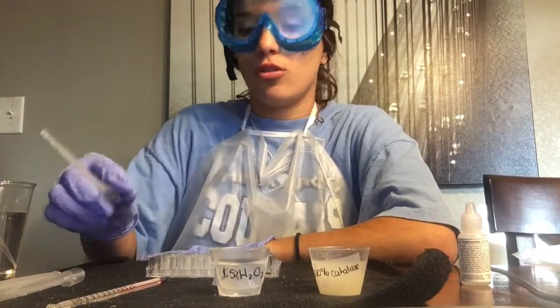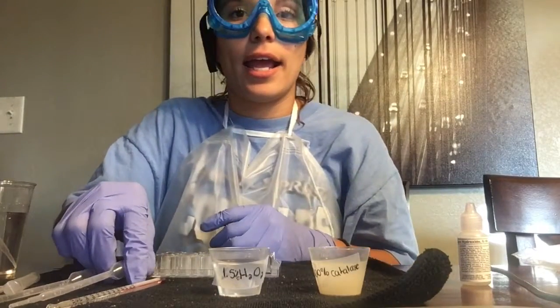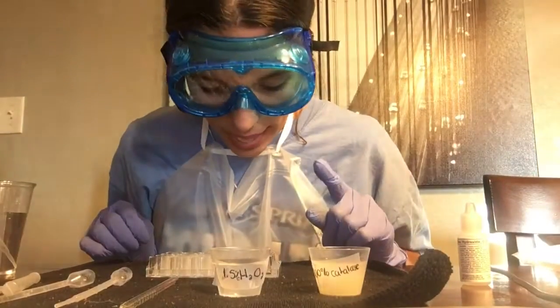Now I'm going to use the water pipette, and I'm going to dispense 18 drops of water into well A3.